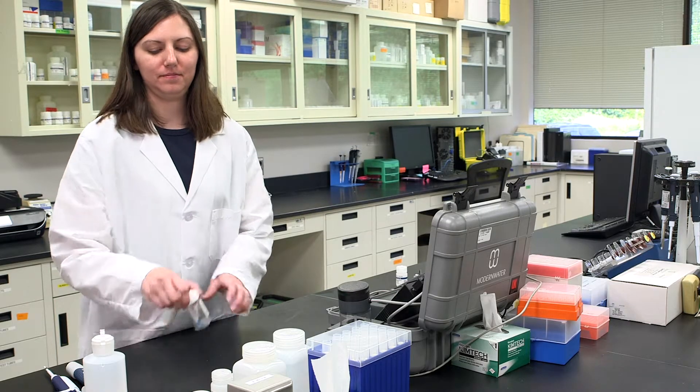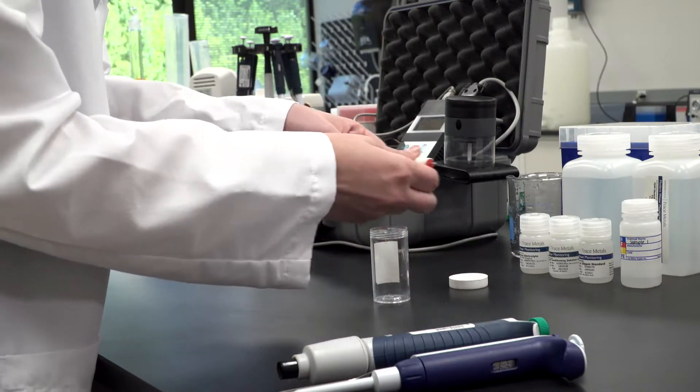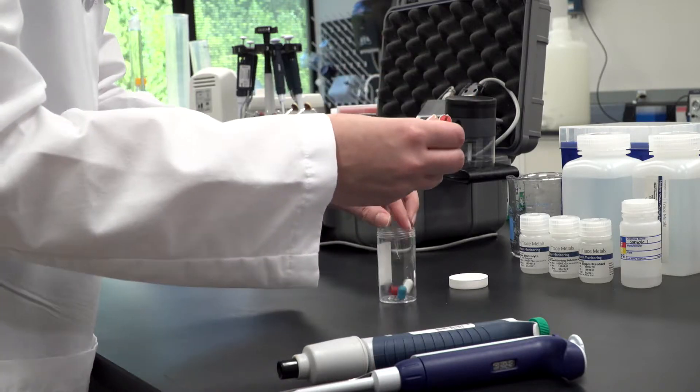Take out all three electrodes from the container and remove the plastic caps. Lay the three electrodes out on a clean surface. Note that they are color-coded: red, blue, and white.